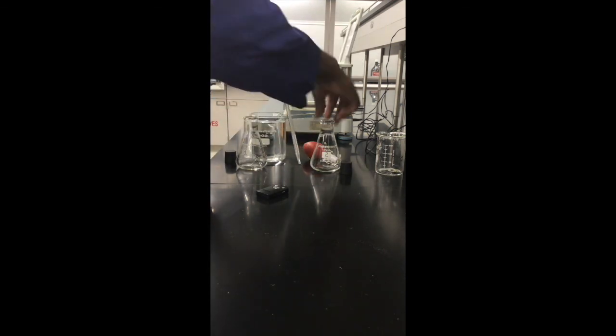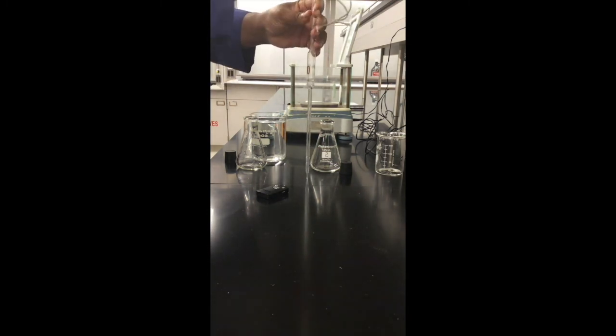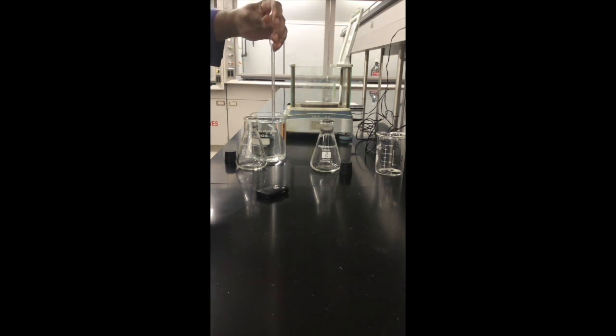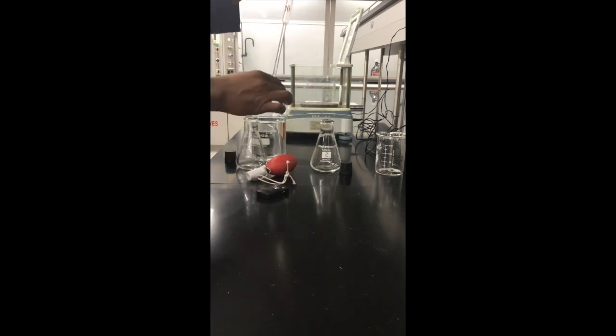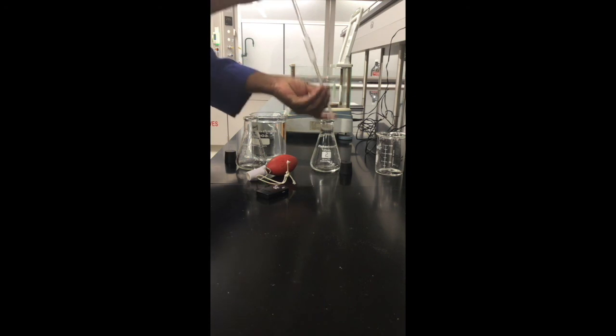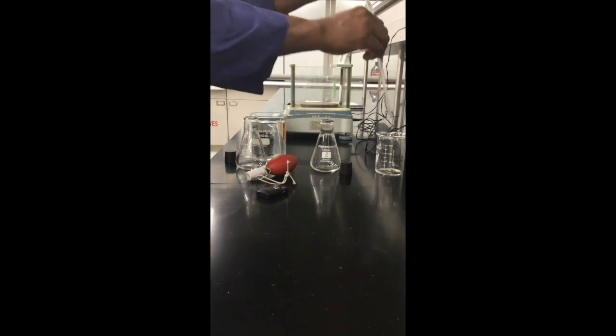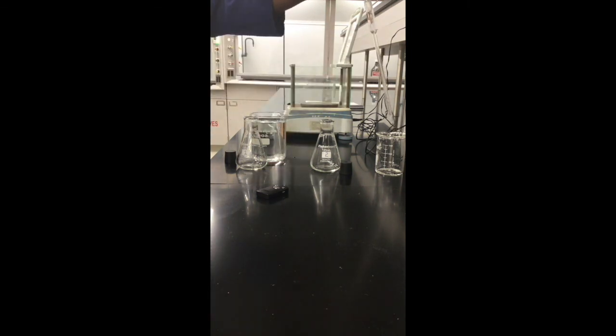What I want to do is what we call conditioning, and conditioning is just filling with a few ml of water or any reagent. You just press the valve and release it gently so that you pipette the liquid, in this case H2O, and using your thumb, you can stop. What I'm doing right now is conditioning the pipette with the liquid H2O, and then dispensing it in a waste receptacle.